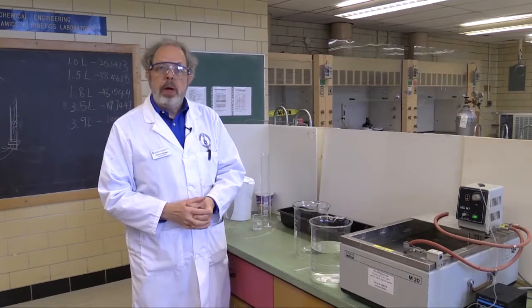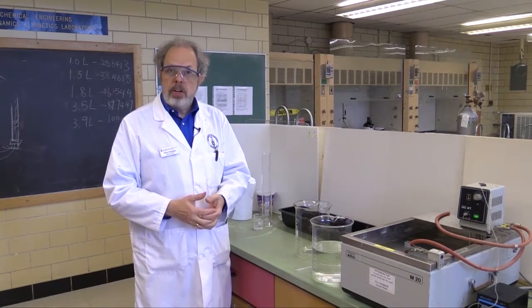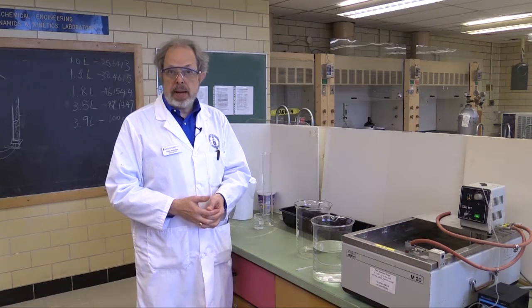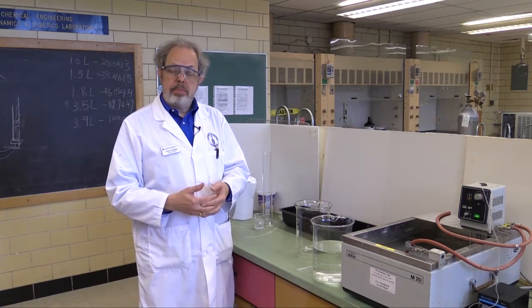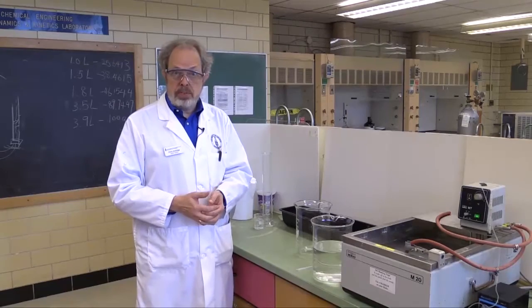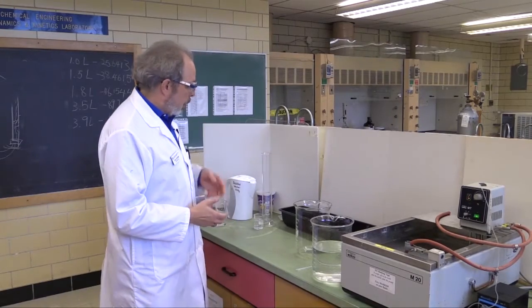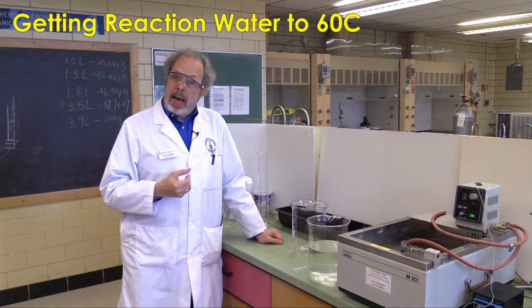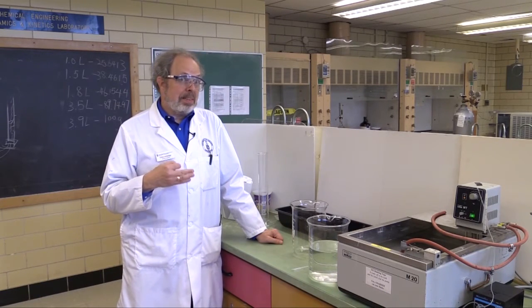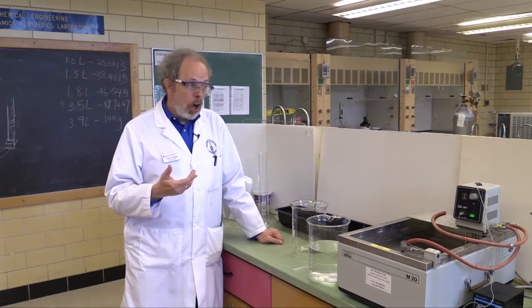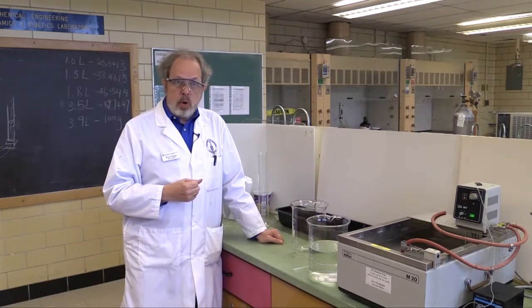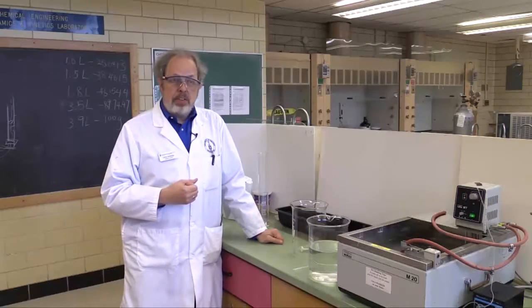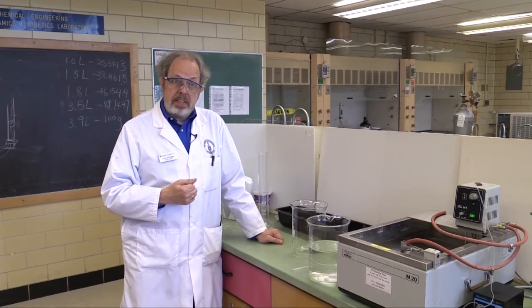This video is to show you how to use the equipment for experiment K4, which is a plug-flow reactor, and you'll be investigating the inversion of sucrose. This reaction, in order to be doable at the lab timescale, has to be done at about 60 degrees, which is not scalding hot, but it is fairly warm. In fact, the slowest thing that happens here is you have to get the reaction water up to 60 degrees.